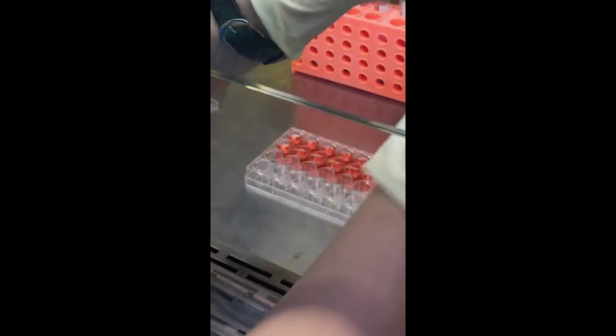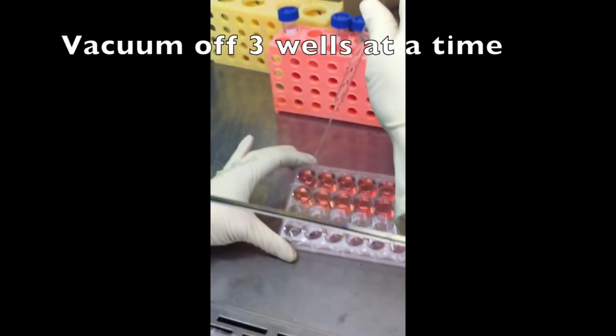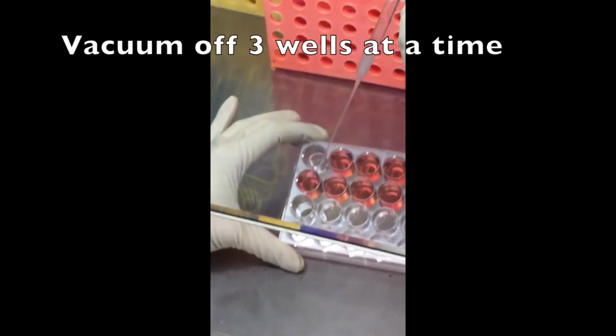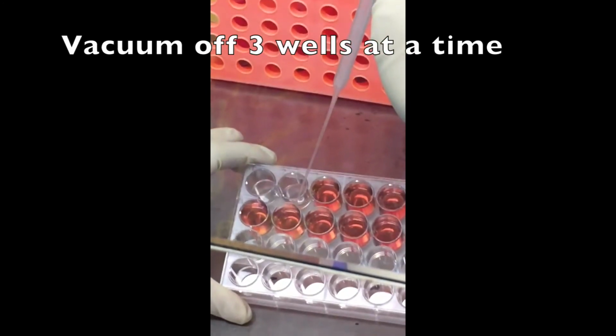You don't want to leave any of the wells without media for too long. So I'm going to just slide the pipette down the back of the well and just gently touch the bottom of the well. Because remember, your cells are stuck on the bottom, and so you do not want to vacuum them off.